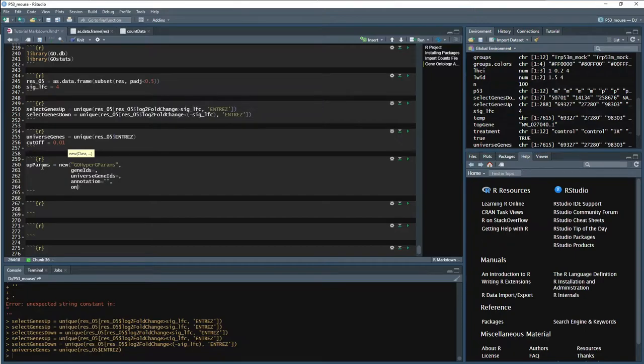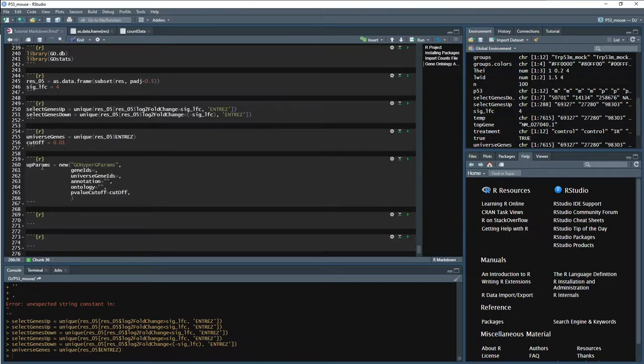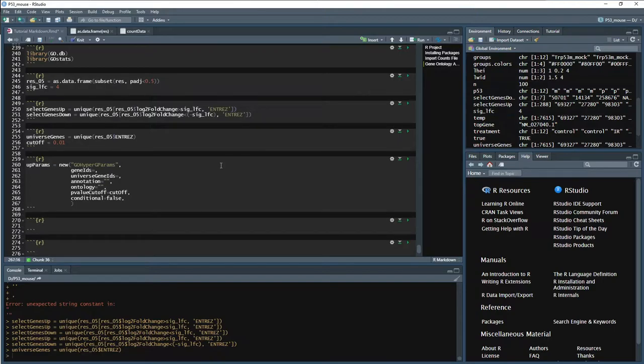then we need our ontology. So our ontology is going to be what we talked about before with the BP. So we want to look at biological process, molecular function, or cellular component. That'll go in there. Our p-value cutoff is going to be what we said above. So cutoff, and then conditional, we'll set equal to false. And then test direction, we want to look at over.